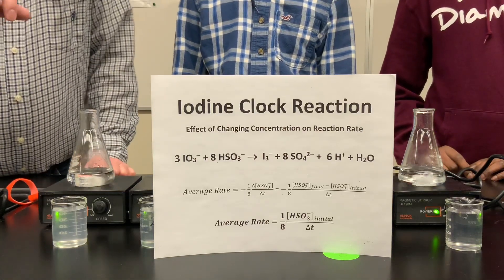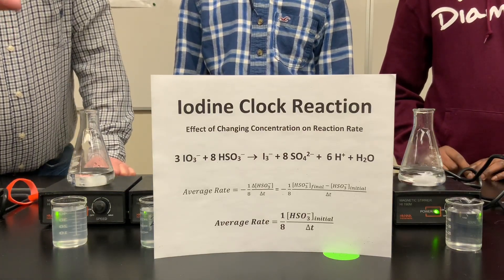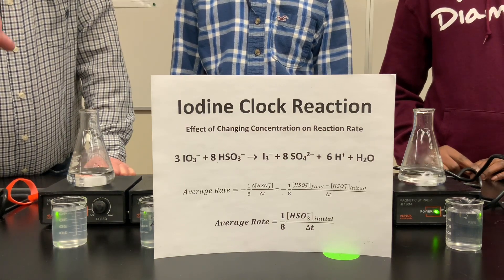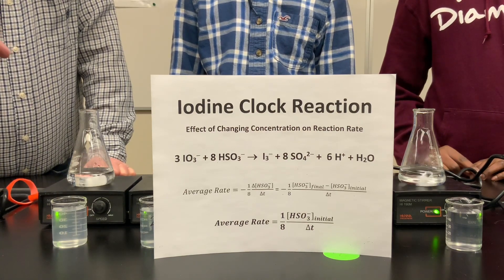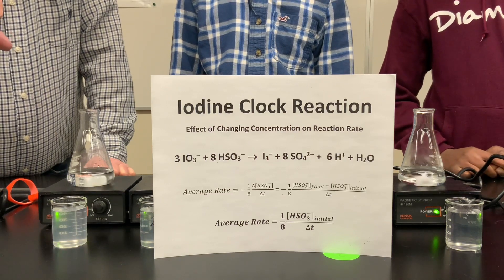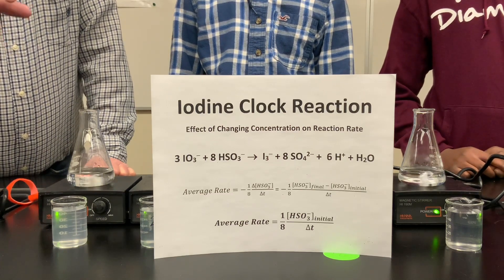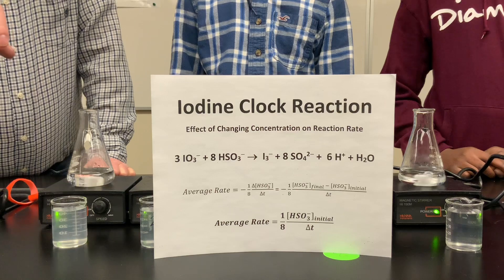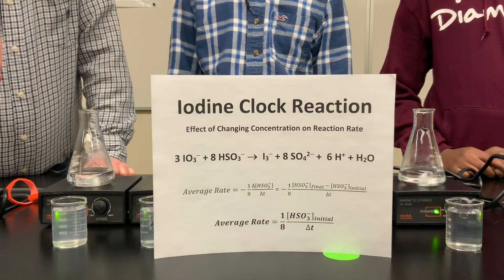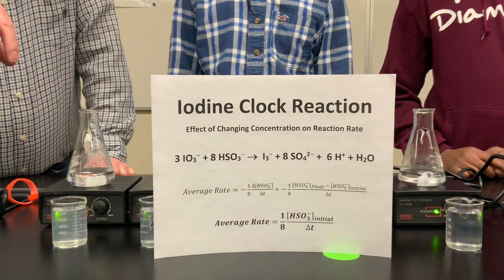Welcome to another chemistry lab video, this one for kinetics. We're looking at one version of the iodine clock reaction. In this reaction, iodate ions, IO3-, are reacting with the hydrogen sulfite or bisulfite ion, HSO3-, and you can see the chemical reaction there.